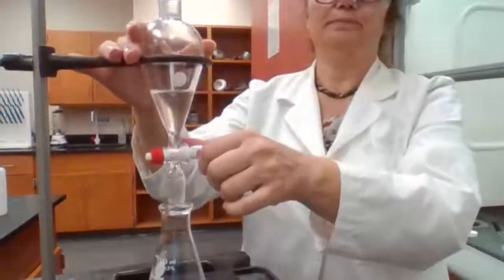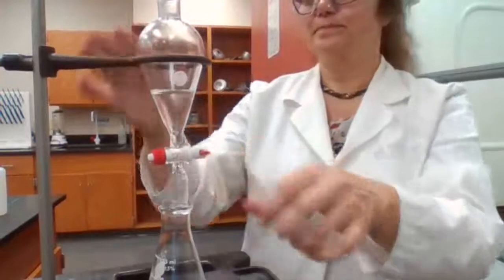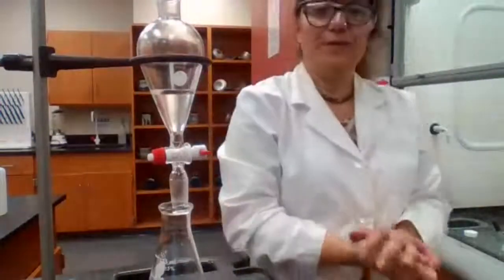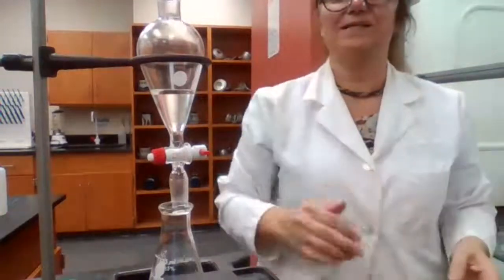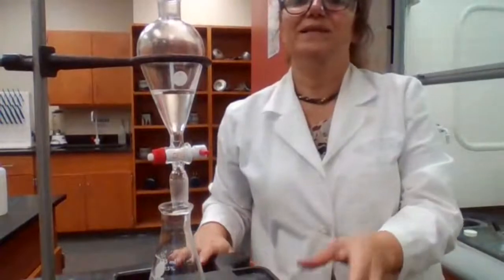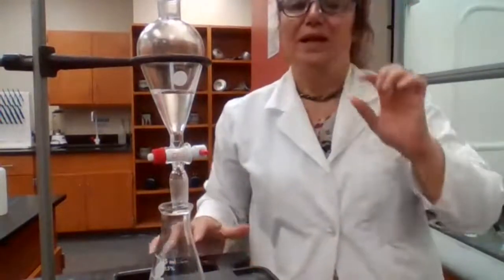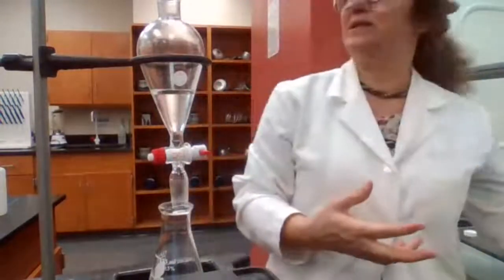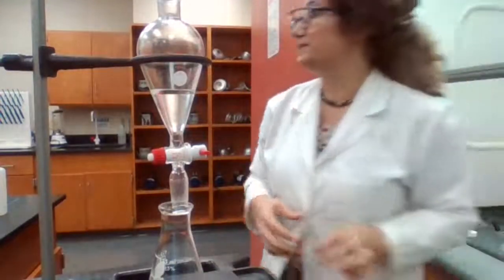What's my next step? You have your lab notebooks, right? Just look at the next step. Tell me what's the step for me. Add 10 milliliters of the deionized water. We are going to do the same. What is the purpose of using the deionized water in this case?